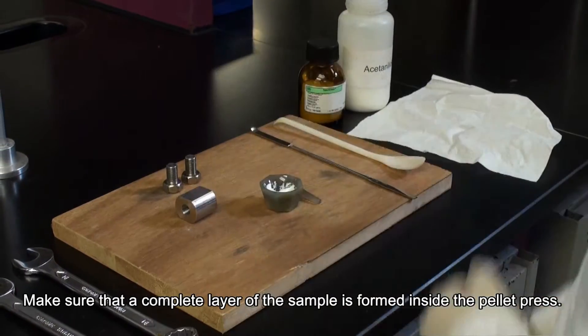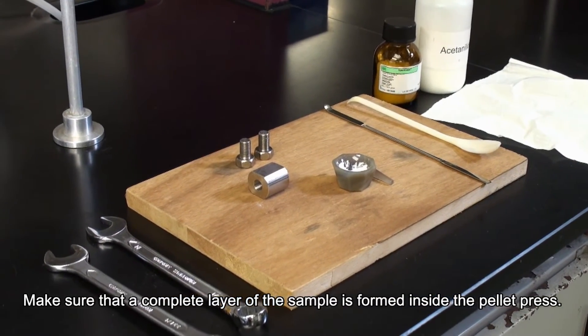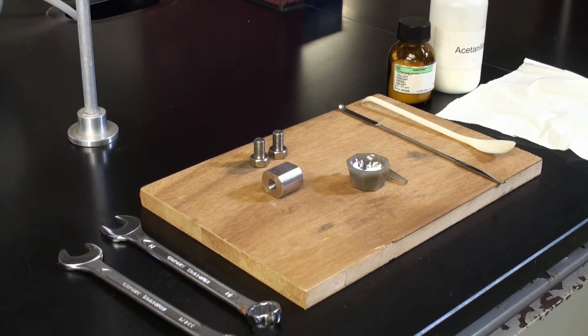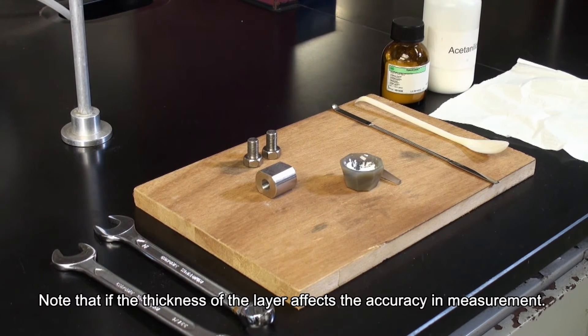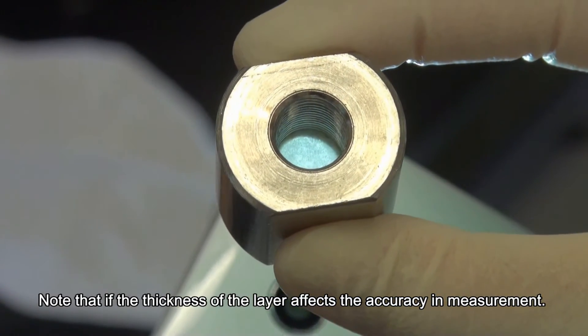Make sure that a complete layer of the sample is formed inside a pellet press. Note that the thickness of the layer affects the accuracy in measurement.